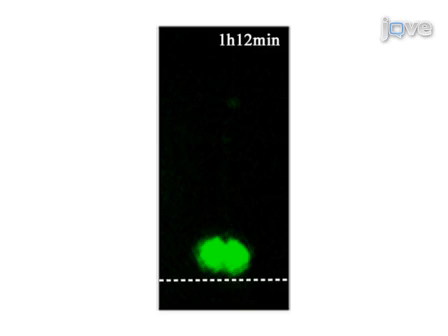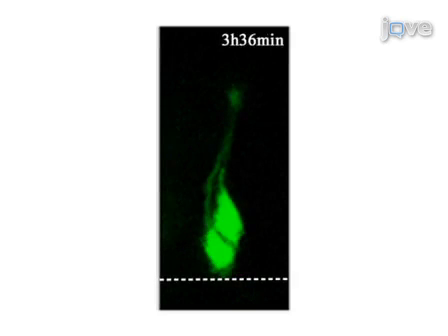The results show the in vivo development of a particular forebrain neural progenitor cell. This method can provide insight into the in vivo development of forebrain neural progenitor cells. It can also be applied to other regions of the central nervous system, such as the midbrain, hindbrain, and the spinal cord.